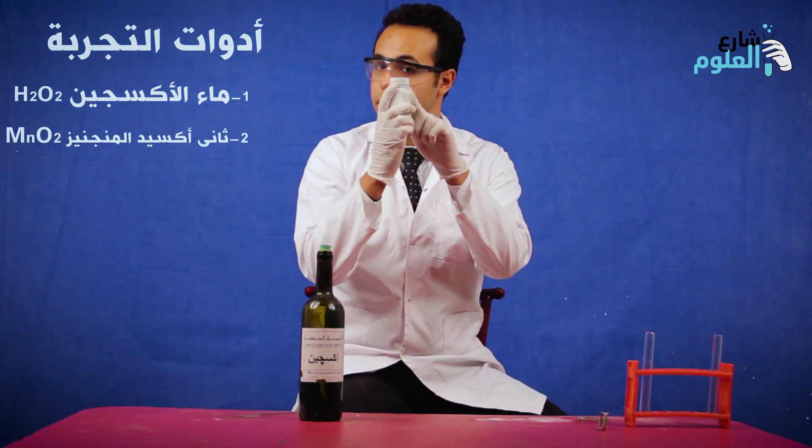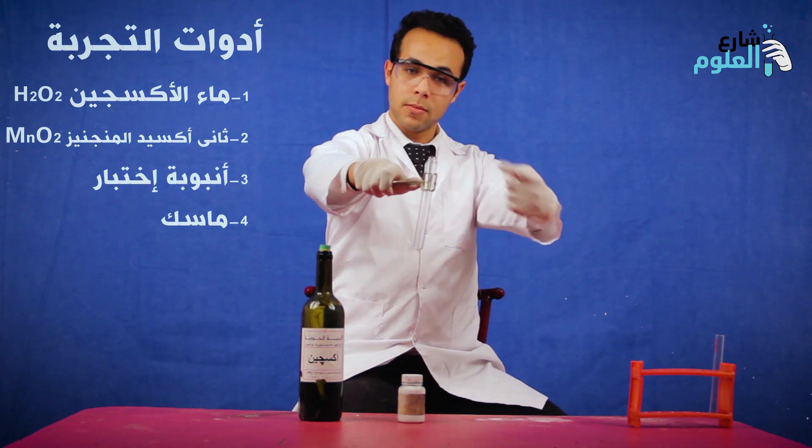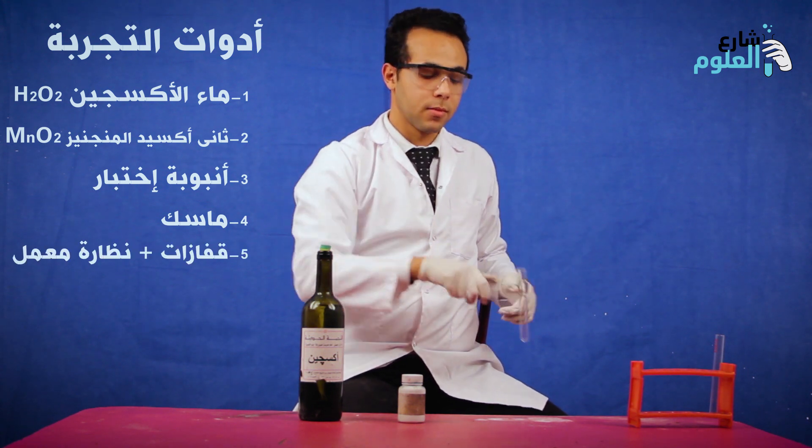The catalyst can help drive the decomposition of hydrogen peroxide to release oxygen. Today we will do a test and observe what happens when we add the catalyst to the hydrogen peroxide. To be safe and conduct the experiment properly, we will use the required materials and follow the procedure carefully.